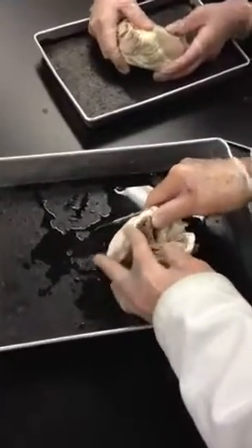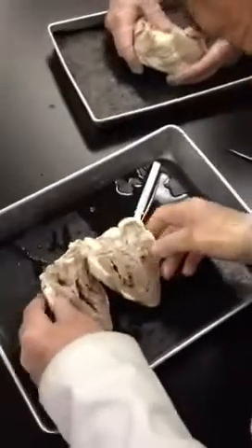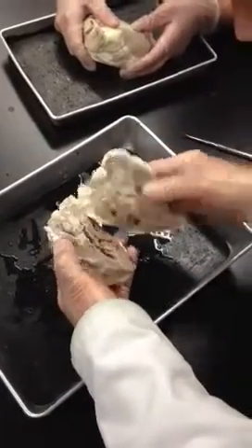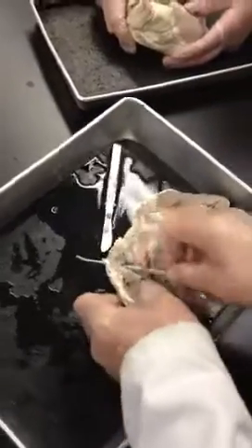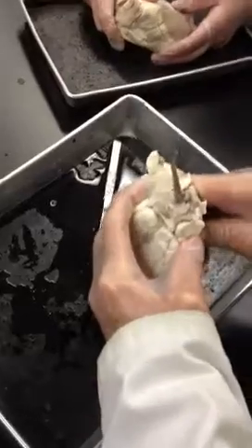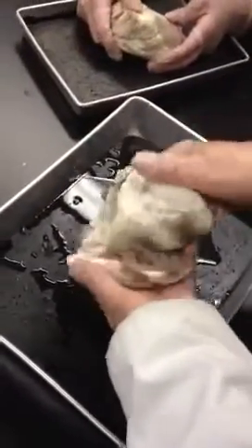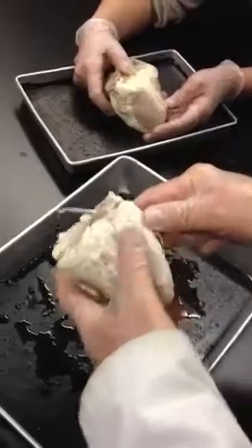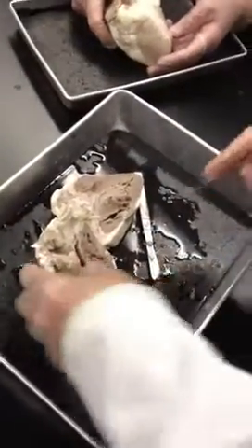Okay, I said this was the left and this was the right. So now this is the left, therefore this should be the superior vena cava coming in here. Let's see — number 13, superior vena cava, it's right here. Let's see if that follows from the way they're looking at it. From this angle, that would be the superior vena cava.